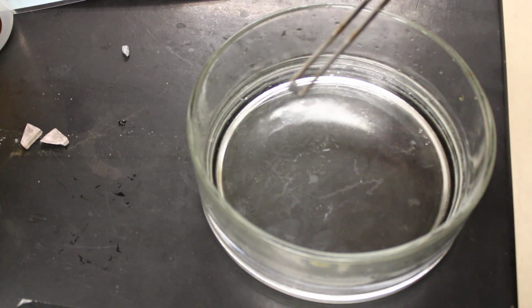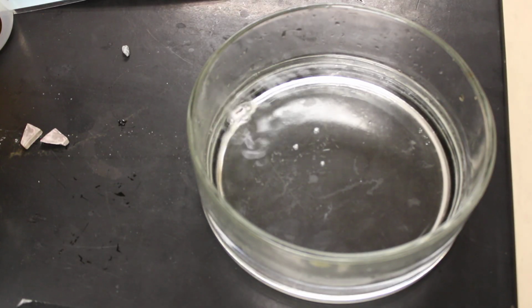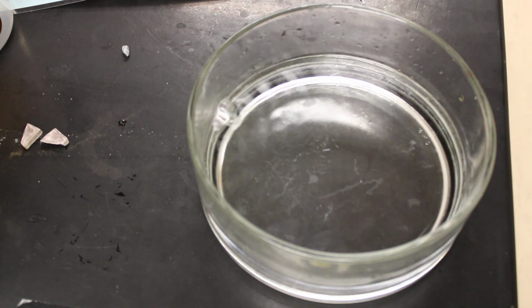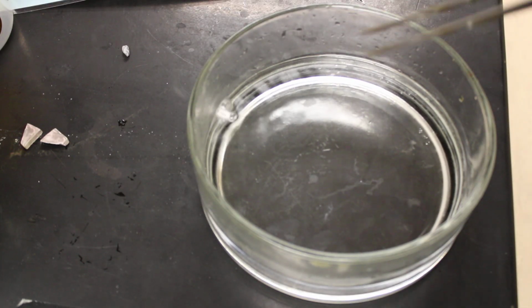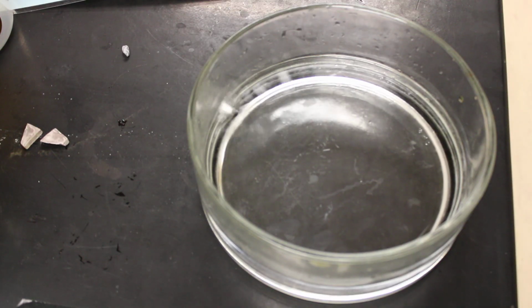This is lithium, so when I put that in water, you can see that it bubbles around a little bit and pops and fizzes, and what it's doing there is it's reacting with the water molecules, and you can see possibly a little bit of the gas that's coming off there. That's hydrogen gas being released from the water, and then of course the lithium ions are now becoming dissolved in the water there, and this water is slowly becoming basic now as we're changing some of that water into OH.